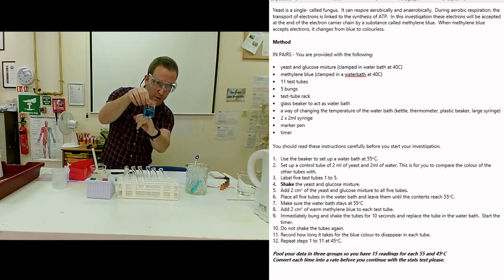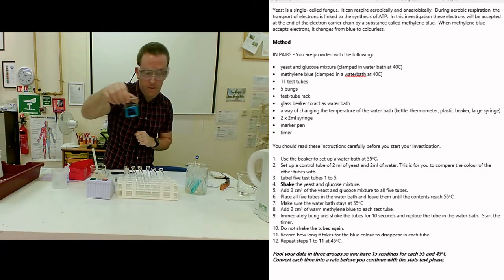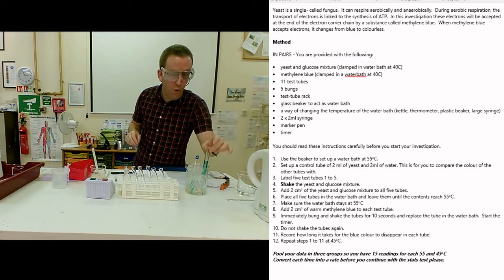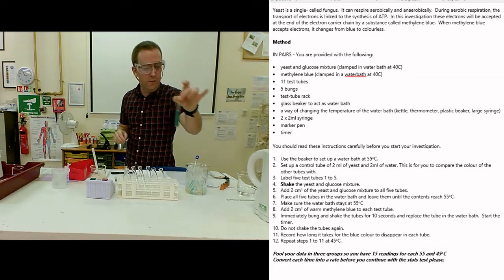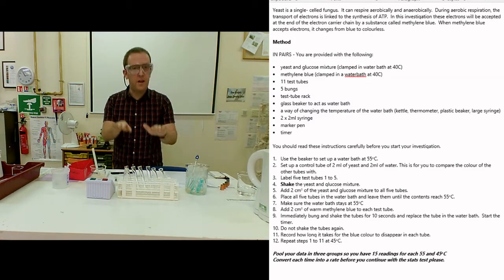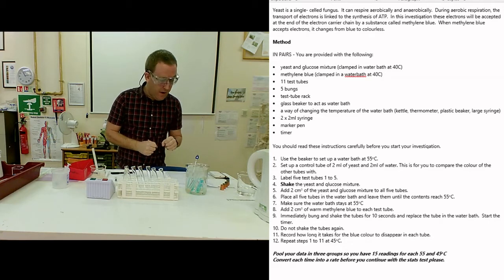Now I've taken a bunch of that already and started to warm it up to the temperature of the water bath, so that when I add the stain to this it doesn't drop the temperature of the yeast again - that is another variable. The next bit is where I need to be a little bit speedy.